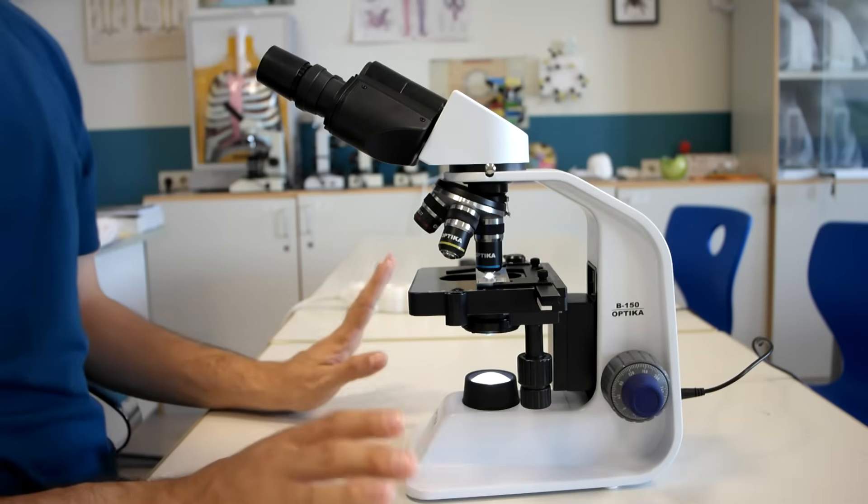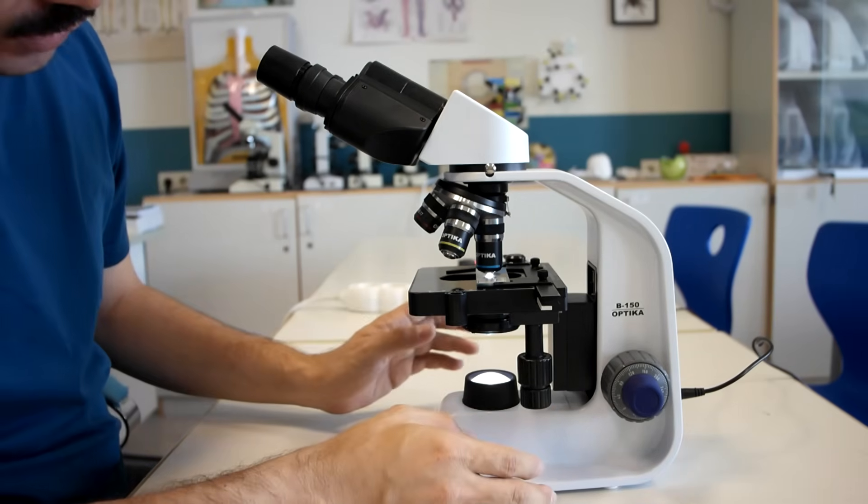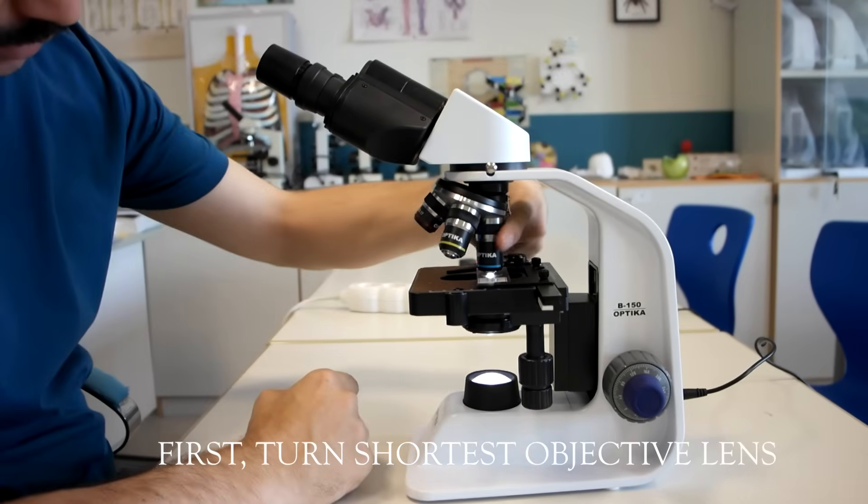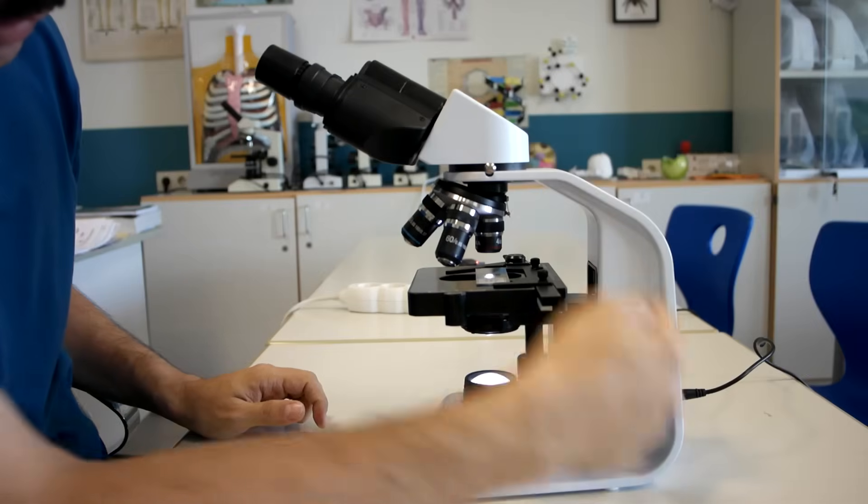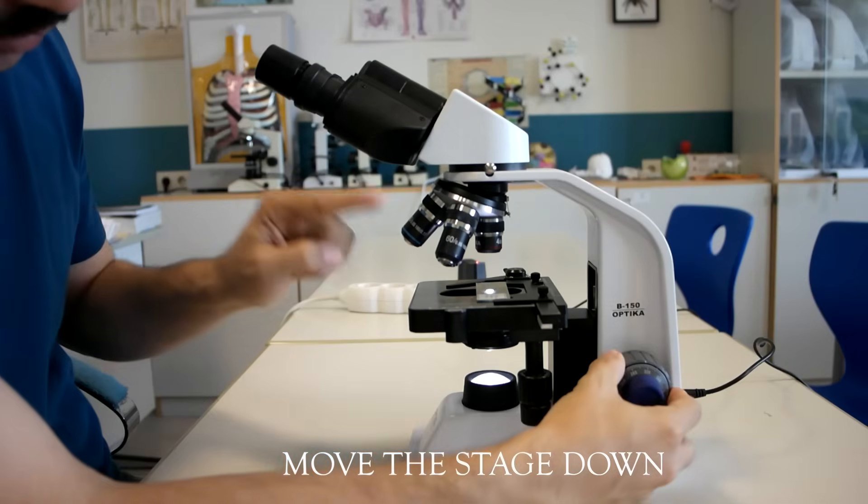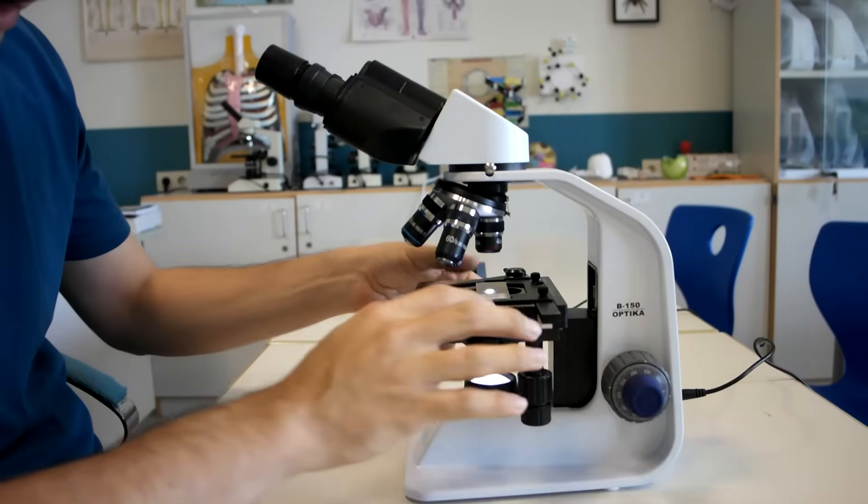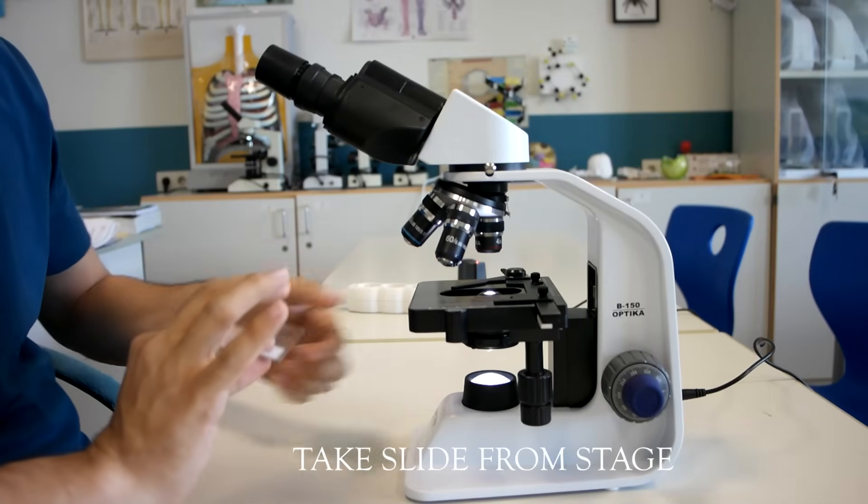When you're done, before touching anything else, make sure to turn back to the shortest one, and then by using the coarse adjustment, make sure the stage is down and then take the slide out.